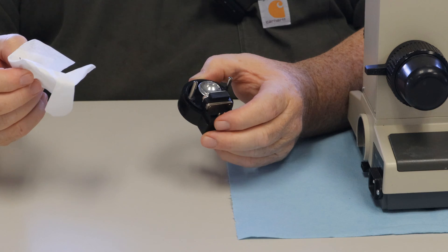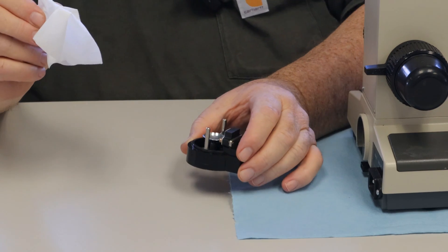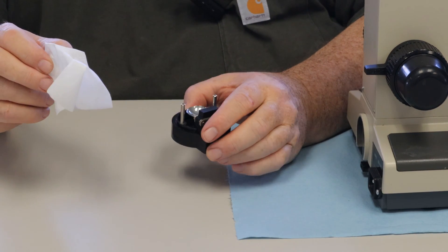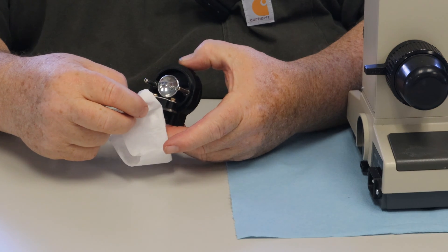This bulb came out hard. Do you see how hard that was? That is the correct way. If it comes out too soft or too loose, it is arcing in there.